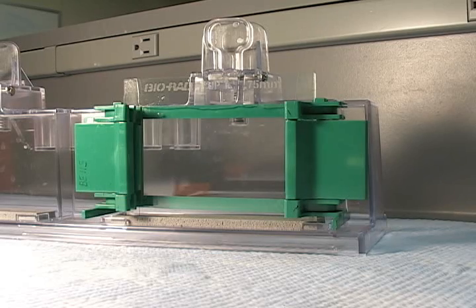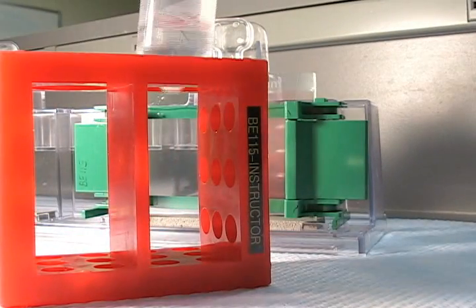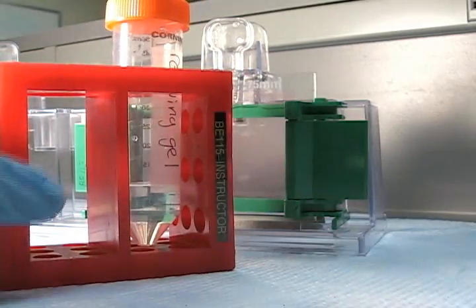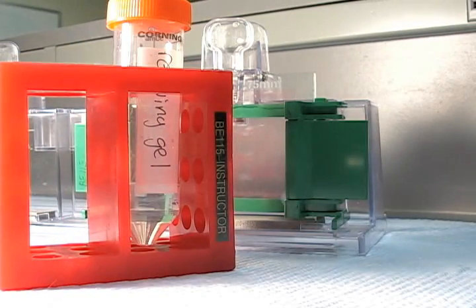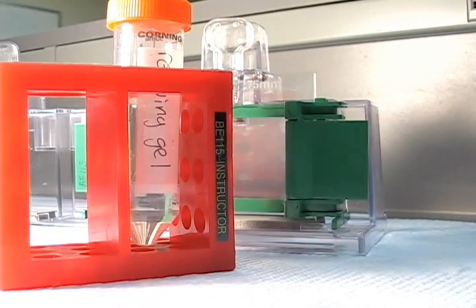When I'm done, I take the leftovers in the tube and place them in the middle of the rack. Make sure that the tube is sealed because that way I can use the gel in here to give me an idea of when the gel in here has gelled.